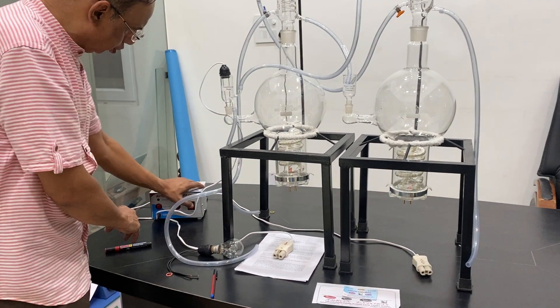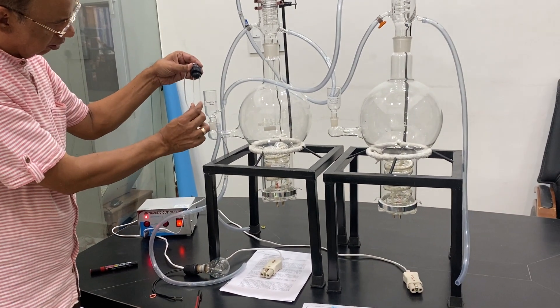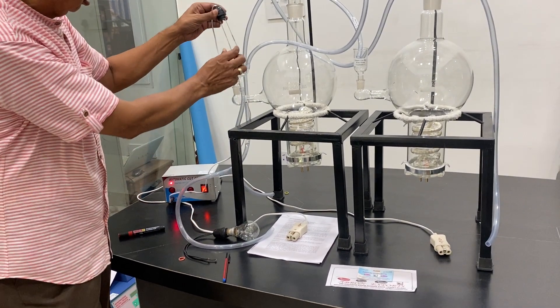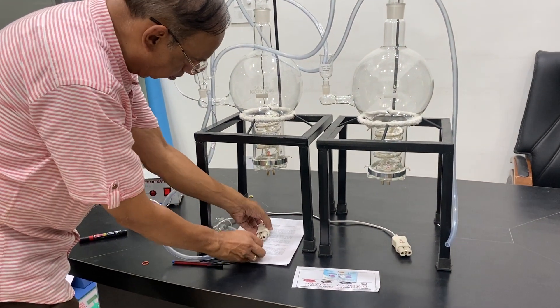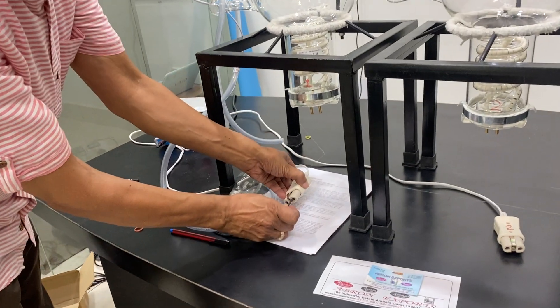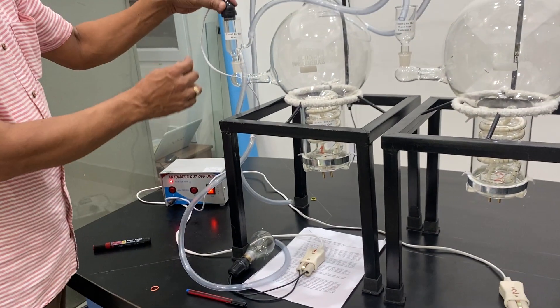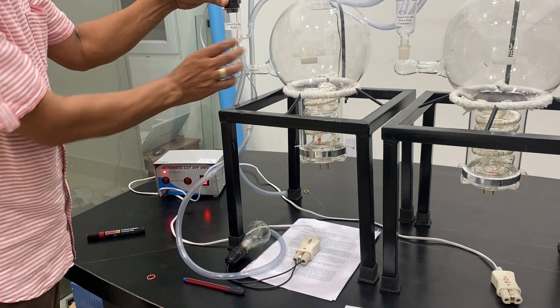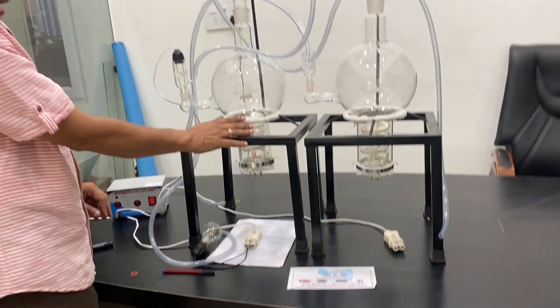So I show you once again. When this is connected, then only the heater starts. I show you another working — there is a probe, you can see my another video for how this is working. This is just for showing you the heater. See this — heater is working, now it is split up. Heater one will be connected only when this is filled with water.